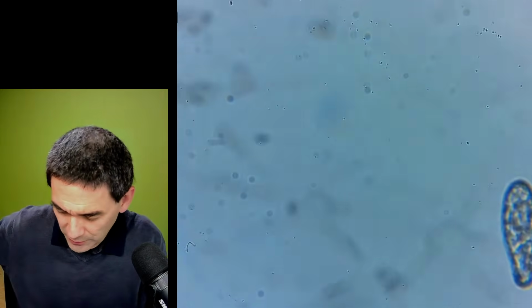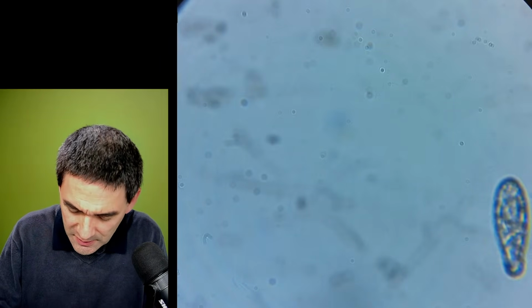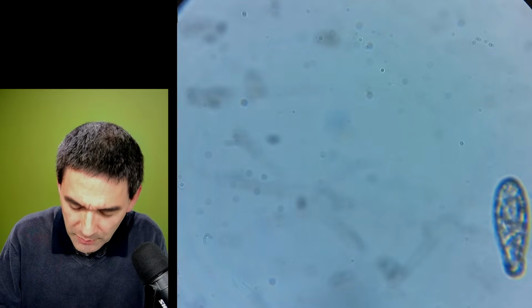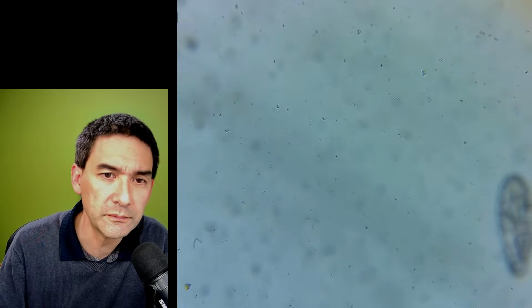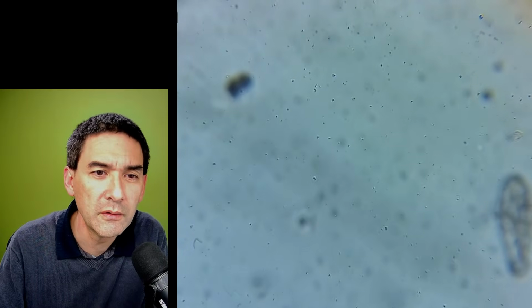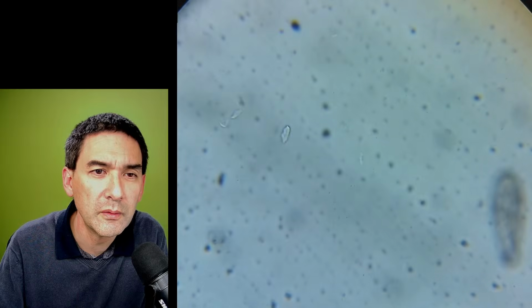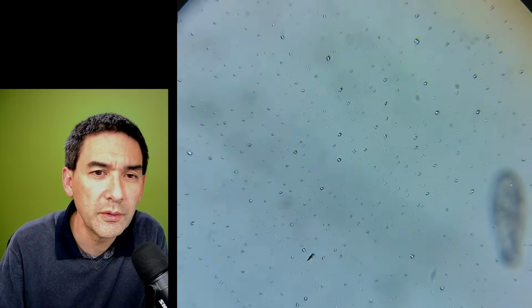So I'm going to do another one. Again a random pick. What is this? Nostoc commune. Okay. Let's see. I don't see anything here. Is there nothing on here?